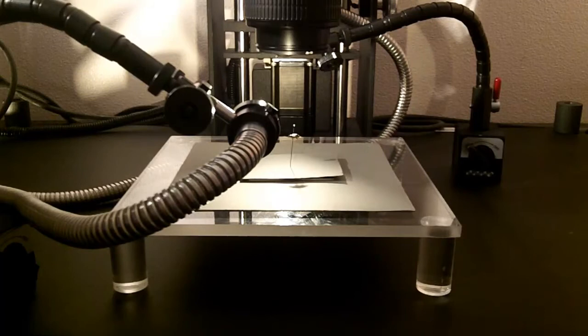What I have done is I have increased the power on the overhead lights so it's the amount of light that I want. And then I very much decreased the power of the light on the fiber optic cables so when that raking light goes over it's not overexposed but it still picks up a lot of detail of the surface of the specimen.